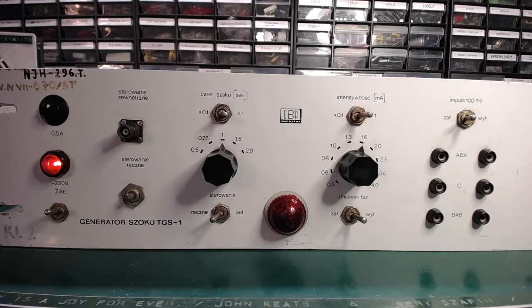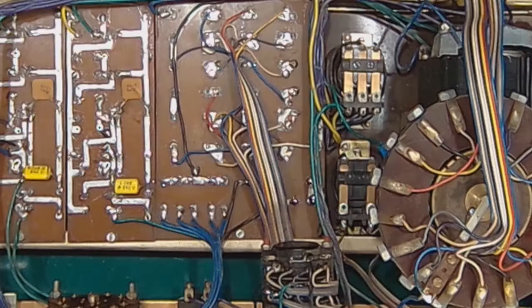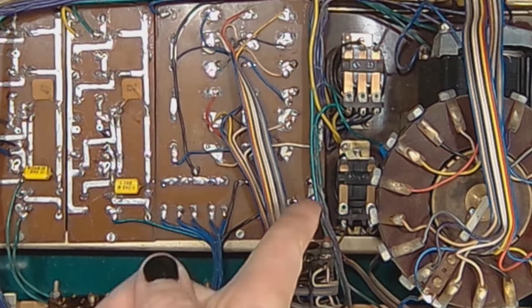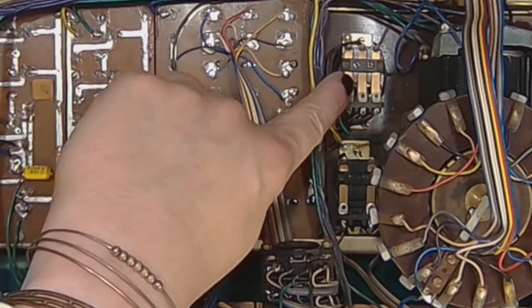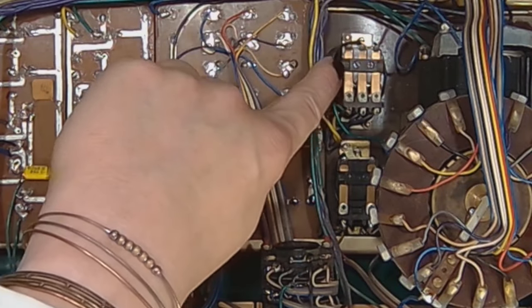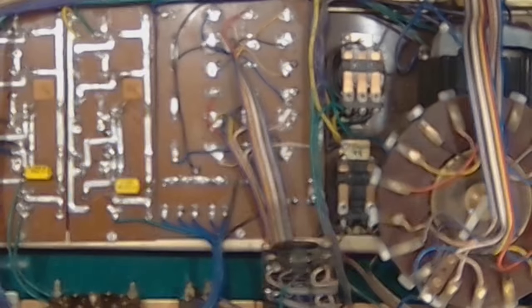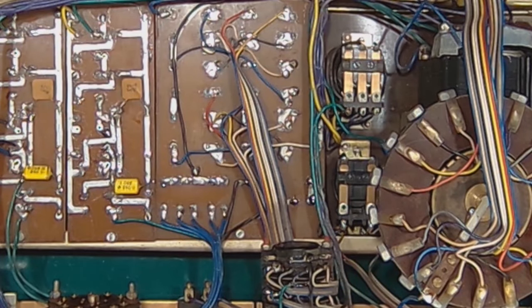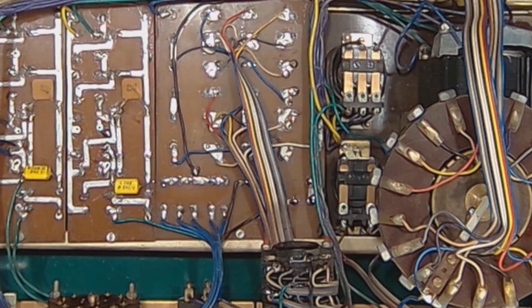And let's get an overhead view. Maybe let's zoom in. There are two relays. One of them controls the shock current, this turns on and off the 450 volts AC transformer. The other one is for changing the contacts on the front panel.